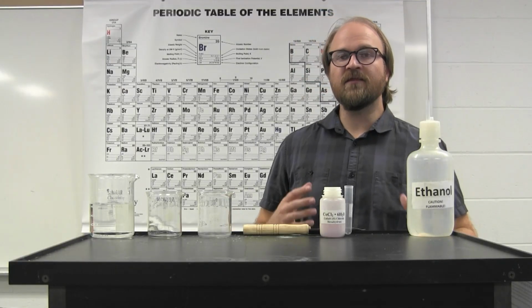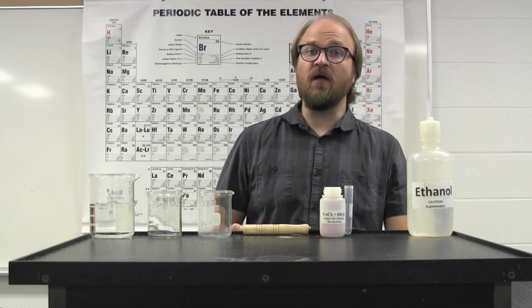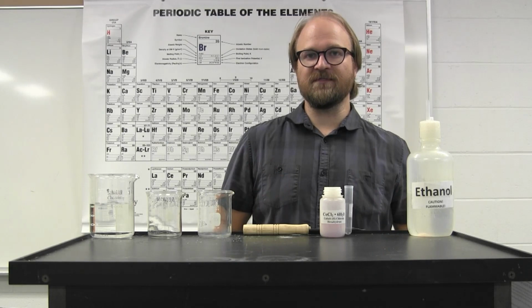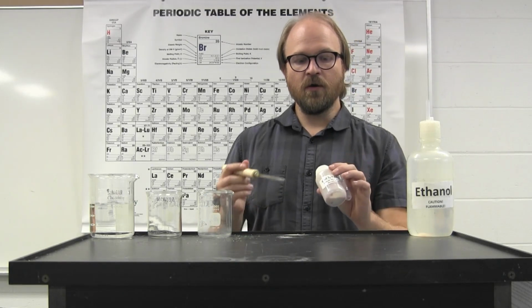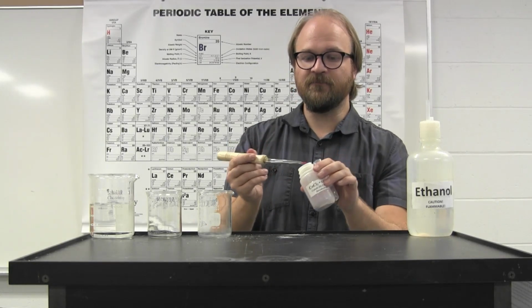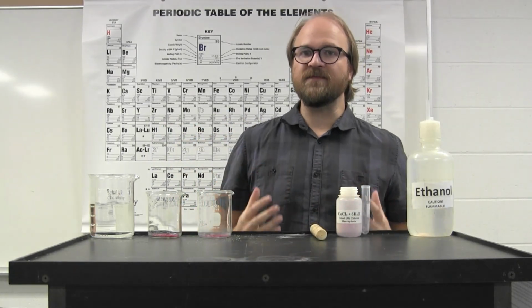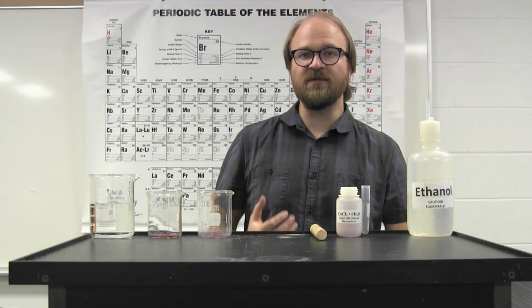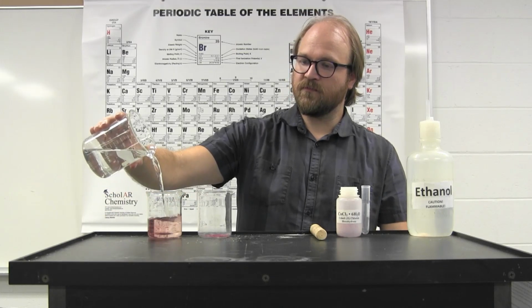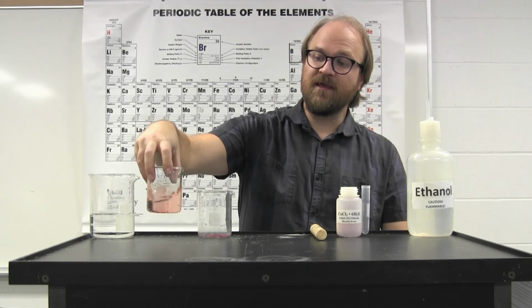In this reaction, the solvent plays a key role. Because the reaction greatly involves the molecules of water, using pure water as the solvent will influence the reaction. Cobalt chloride hexahydrate solid is a red solid. However, depending on what the solvent is, the color of the solution can vary. Solutions dissolved in water retain the red color.